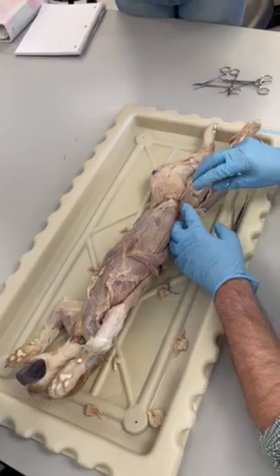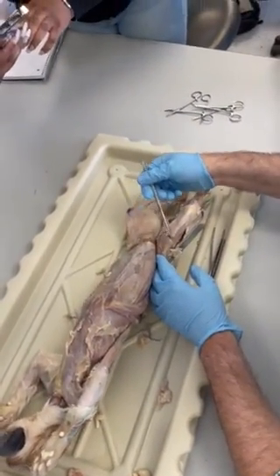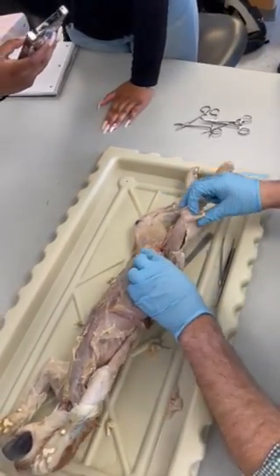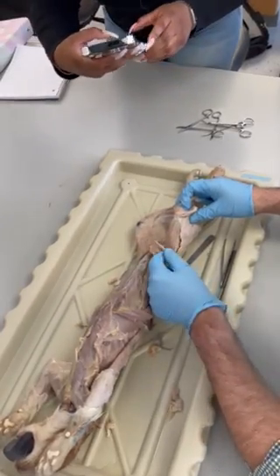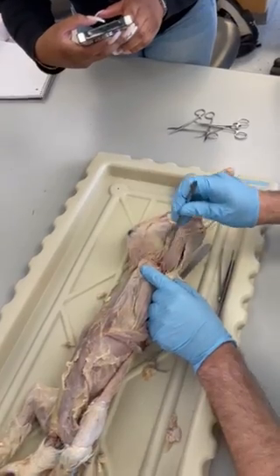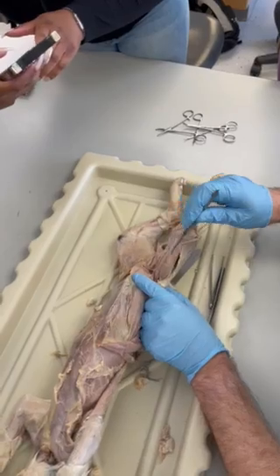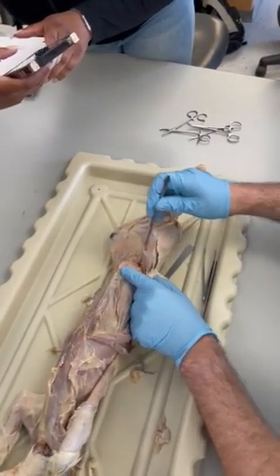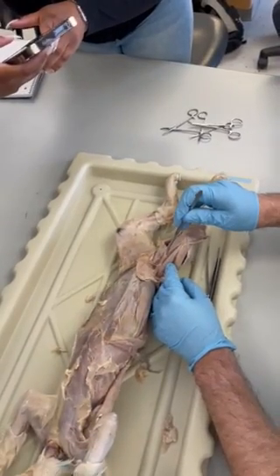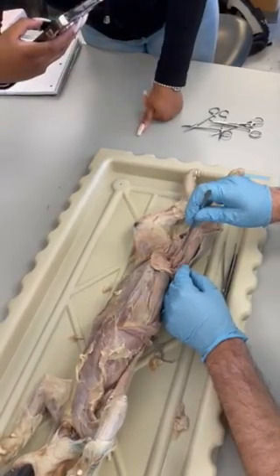All right. Moving into the thigh, we got sartorius here. I've cut and reflected. Reflect that back. This is the tensor fasciae latae that was on your list. Okay. This is the quadriceps group. We have right in the middle the rectus femoris. We got the vastus lateralis to the side of that, and then the vastus medialis. We're not identifying vastus intermedius on the cat, but we know it's underneath the rectus femoris.